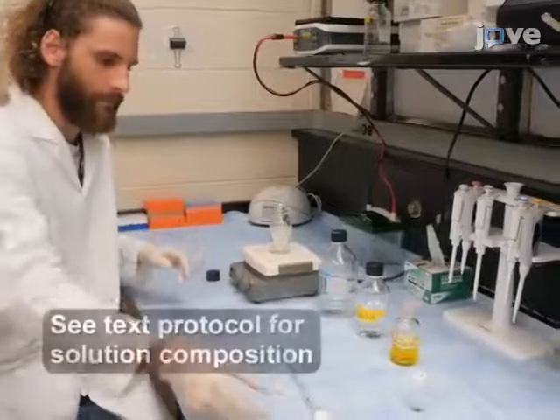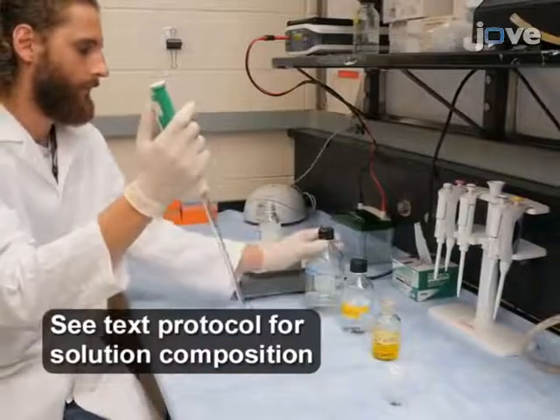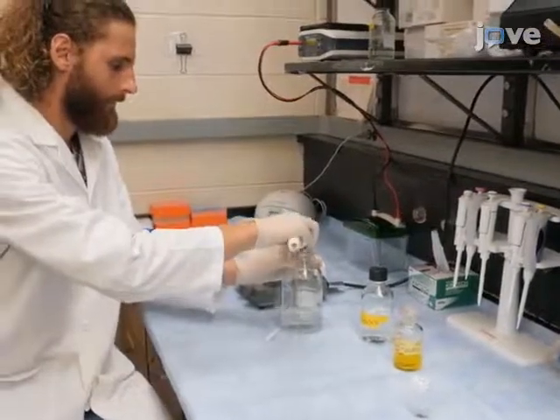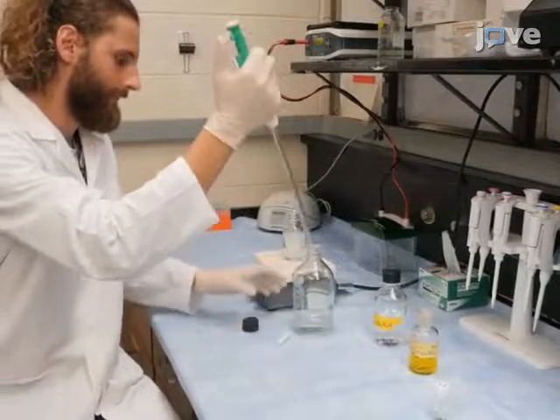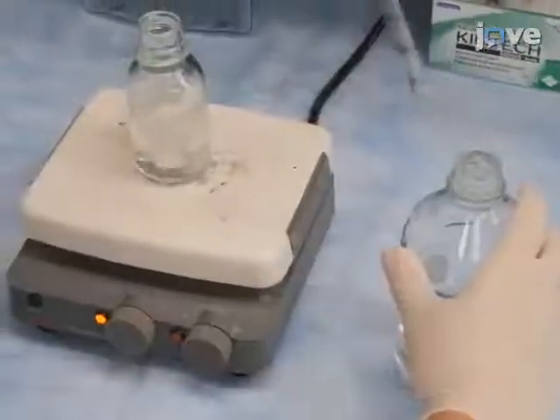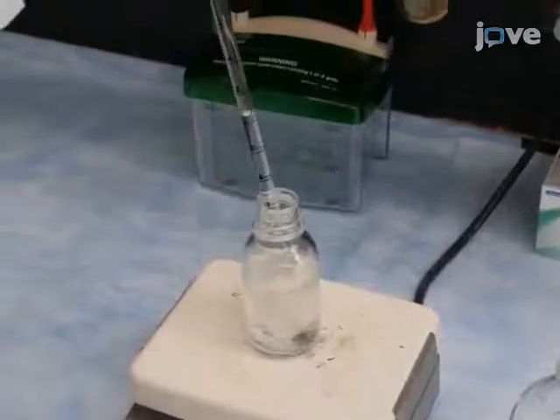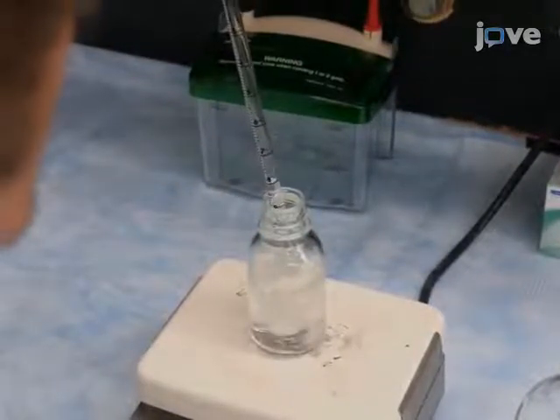After preparing all necessary solutions as indicated in the text protocol, begin delay time synthesis of gold oligoclusters by adding 7 milliliters of the borax solution to a clean 125 milliliter glass bottle containing 59.5 milliliters of water under stirring.